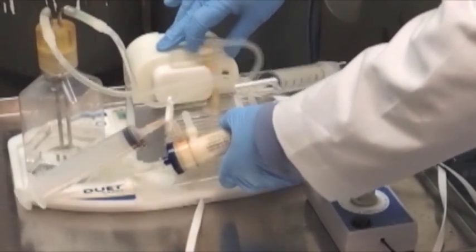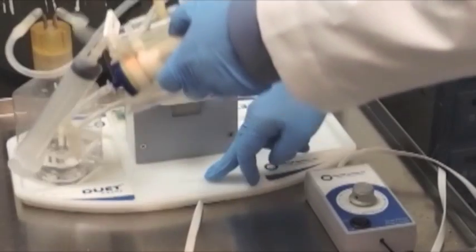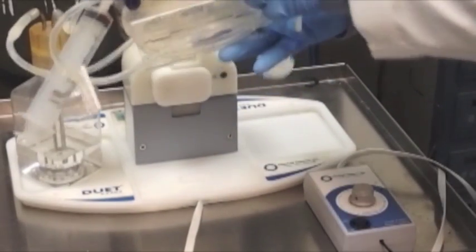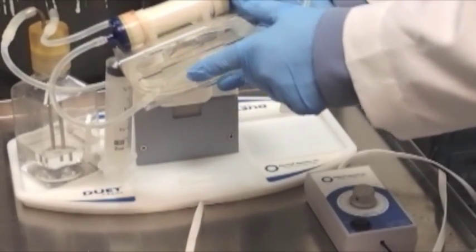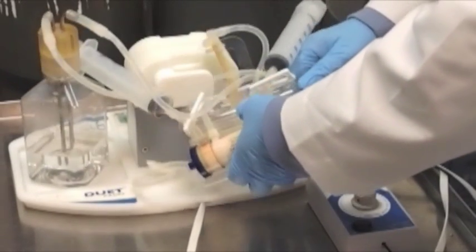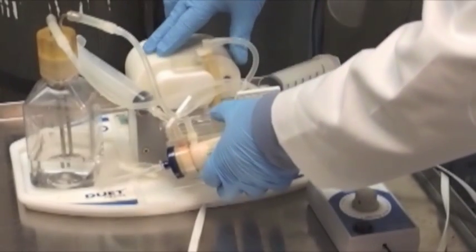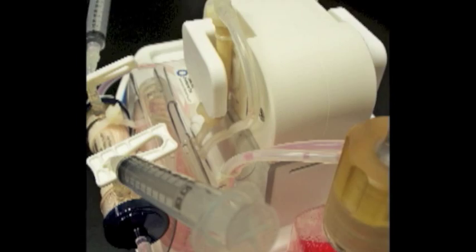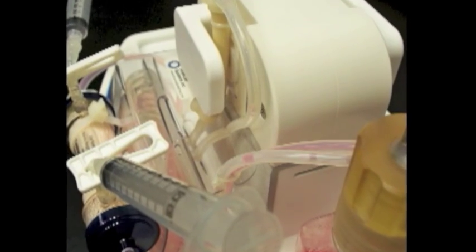There is a corresponding rectangular registration in the Duet along with a hole in the bottom of the flow path to also facilitate correct positioning of the cartridge in the pump. Correct positioning of the cartridge is critical for maintaining good flow rate.